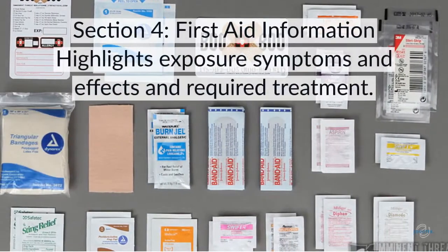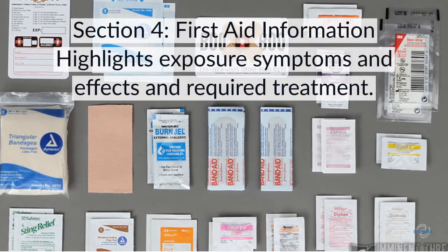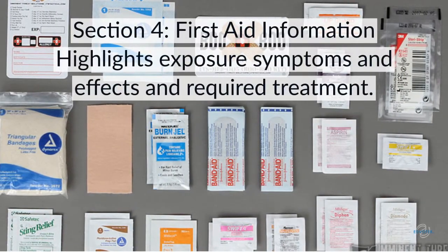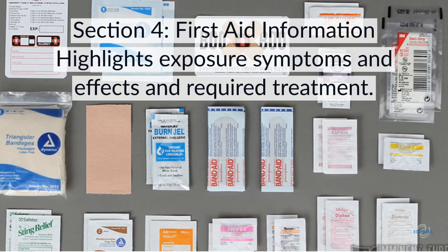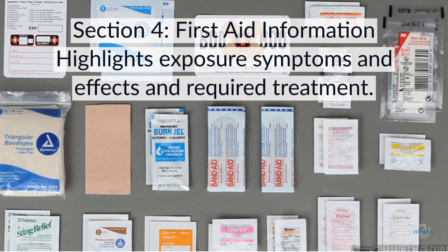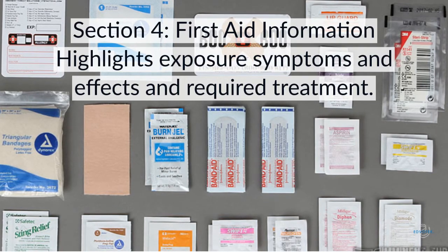If you have an unexpected exposure to the chemical, you'll want to refer to Section 4, First Aid Measures. This section covers important symptoms and effects, both acute and delayed, and the required treatment.